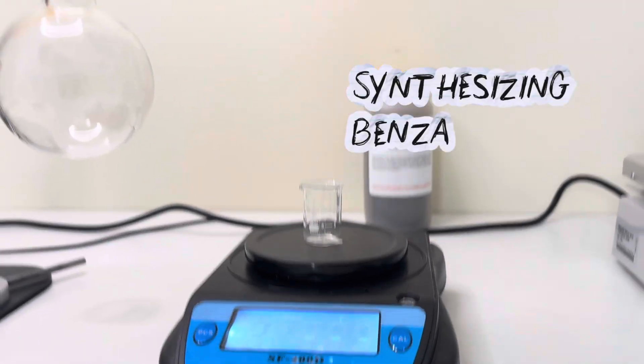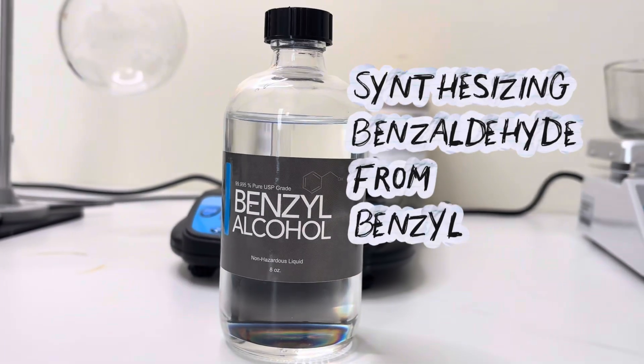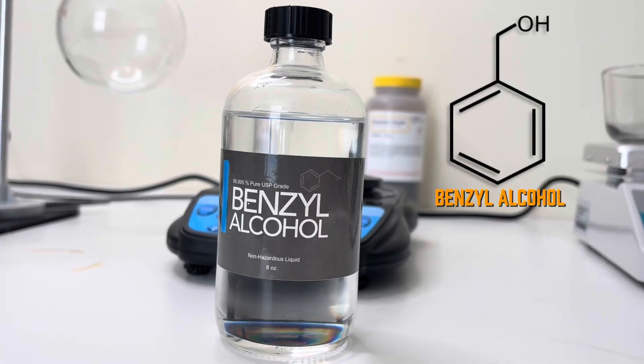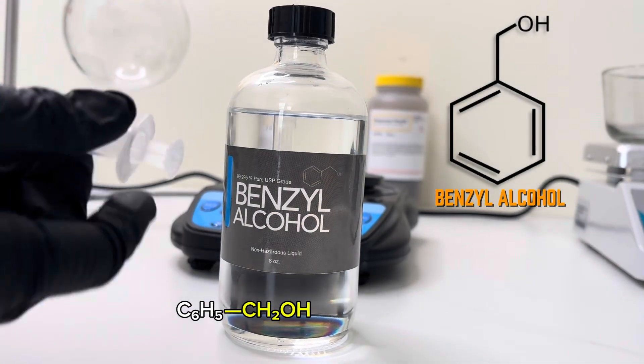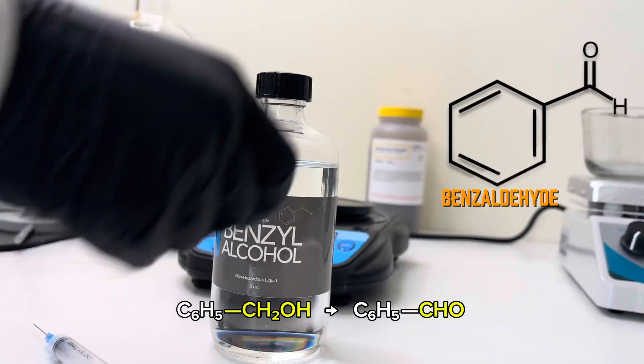Hi guys, today I'll be synthesizing benzaldehyde from benzyl alcohol. Benzyl alcohol contains a benzene ring with a hydroxymethyl group, which can be oxidized to an aldehyde group, forming benzaldehyde.